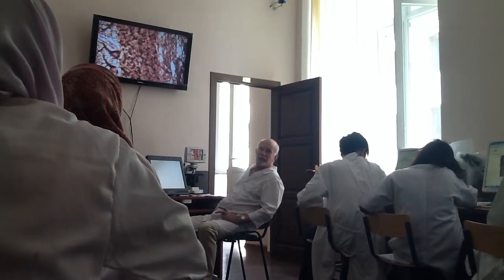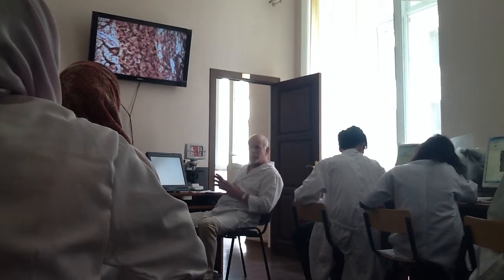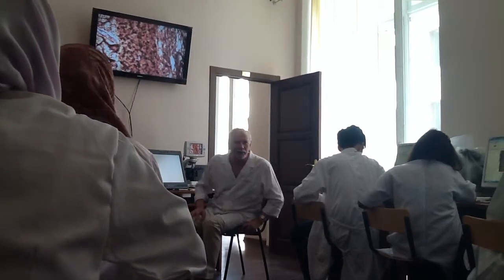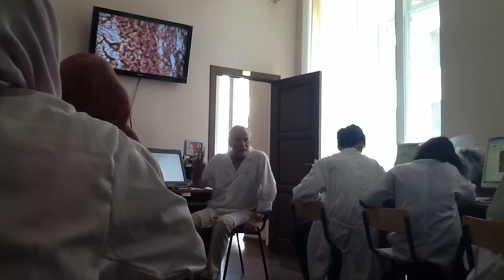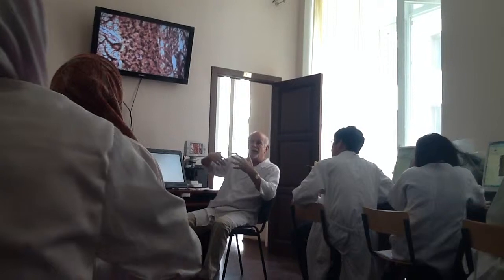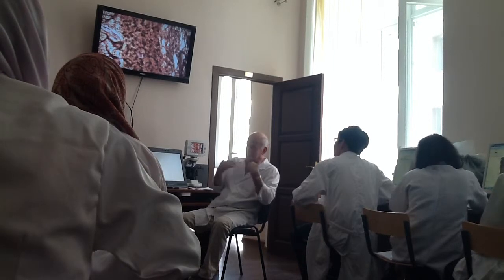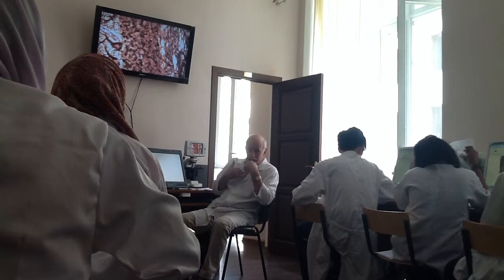Then white matter. So the cellular composition and number of layers in the cerebellum is more simple compared to cerebral cortex. Only 3 layers here. So you must find these layers and indicate the cells present in each layer. If you cannot find some structures, I'm here, ask me. Understand?